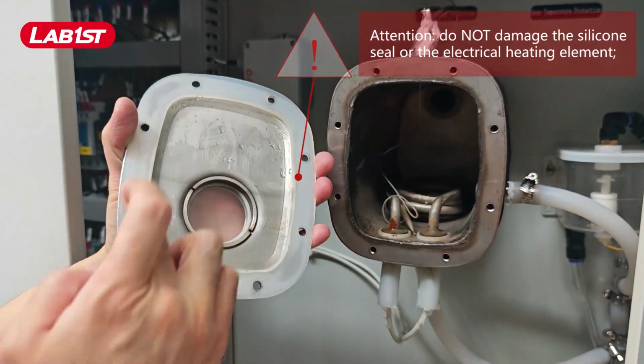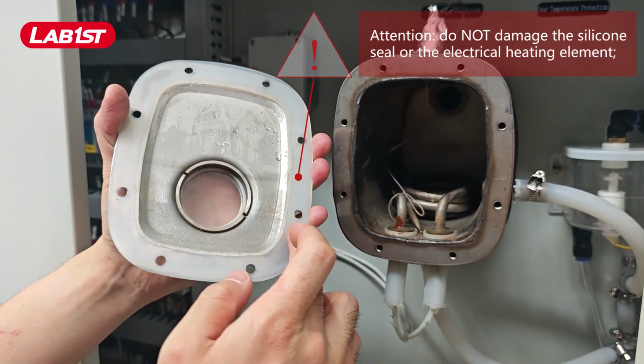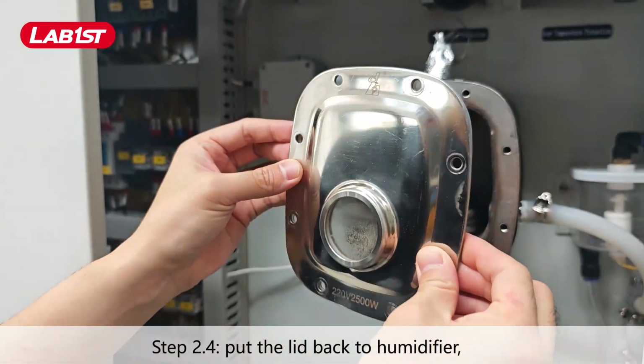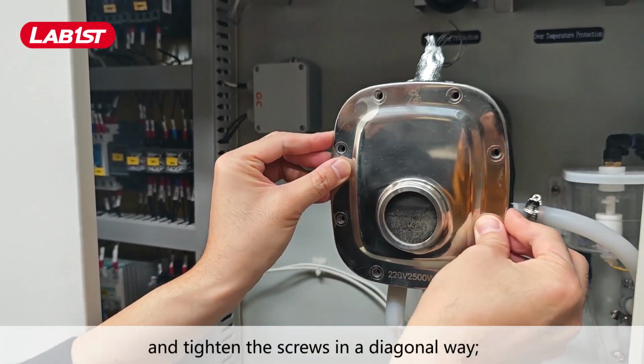Attention, do not damage the silicone seal or the electrical heating element. Step 2.4. Put the lid back to humidifier and tighten the screws in a diagonal way.